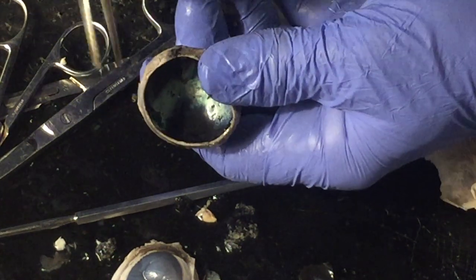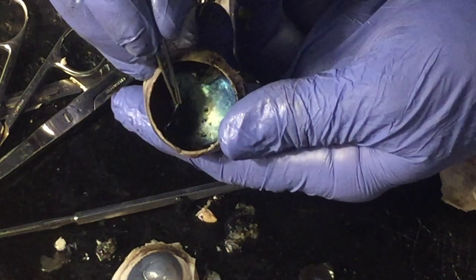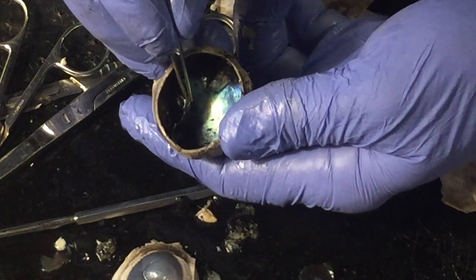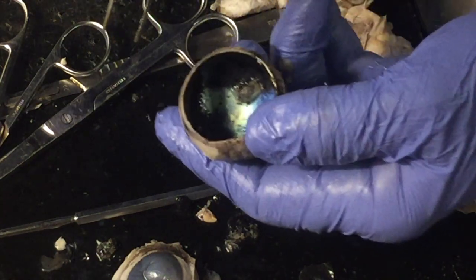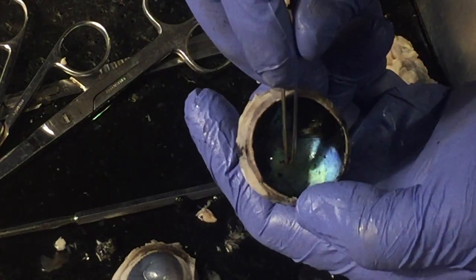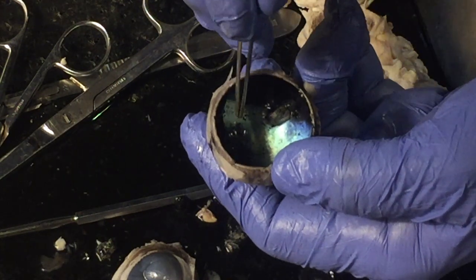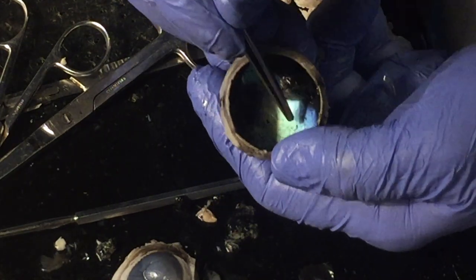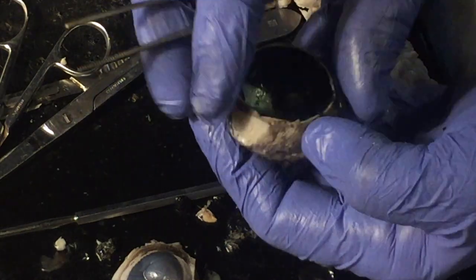Can you see that back? Okay, so right here, if I lift it up, you can see I can lift that layer right up. Humans do not have this. We do not have eyes that glow in light. If you've seen deer or cattle or dogs, their eyes glow in the dark, and that's because light is reflecting off this tapetum lucidum layer that we don't have. Its purpose is to shine light back on the retina so they can see better in low light. The retina would sit right on top of that layer, and again, that's what perceives images.